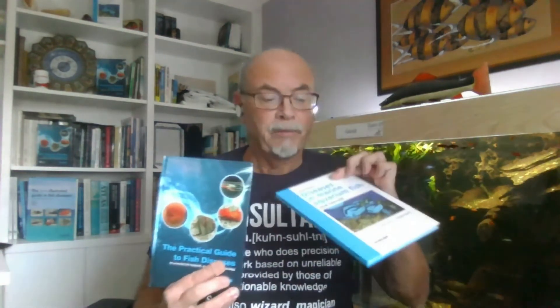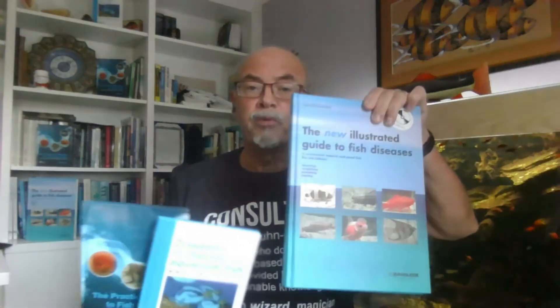In the coming sessions on fish disease diagnosis, I will try to explain more than what you can find in the books. The books contain interesting information that I published in three books still available in English. But taking care of fish involves more than reading — it's about using a microscope and learning to practically use that tool to identify the most common diseases. It's not difficult; it just follows certain rules and ways of handling problems.